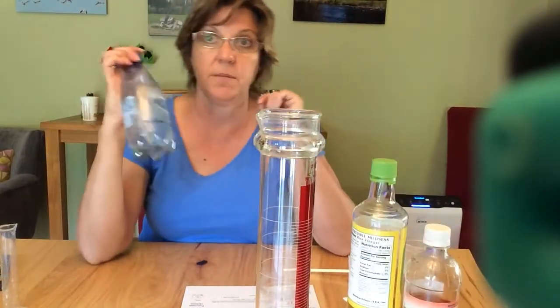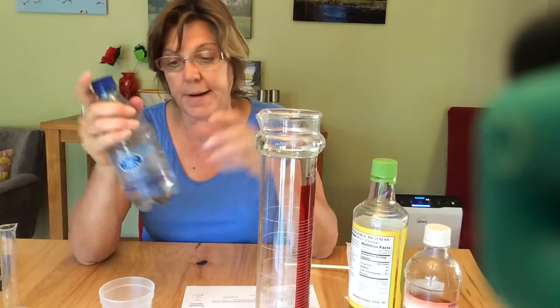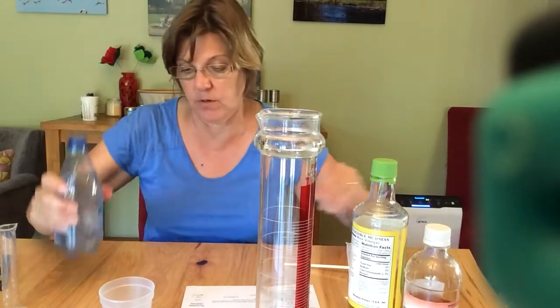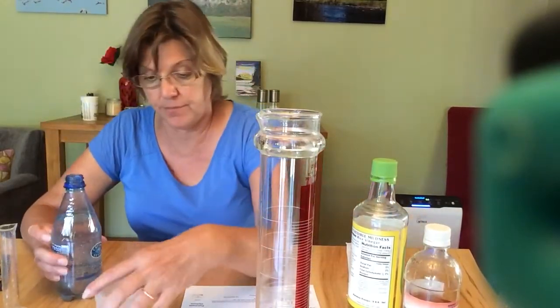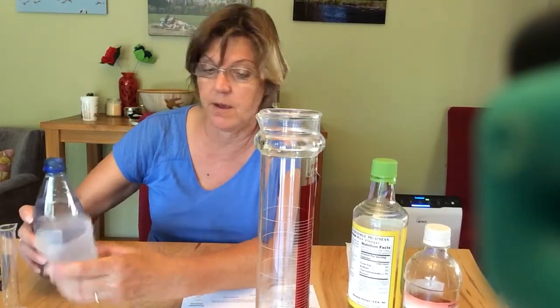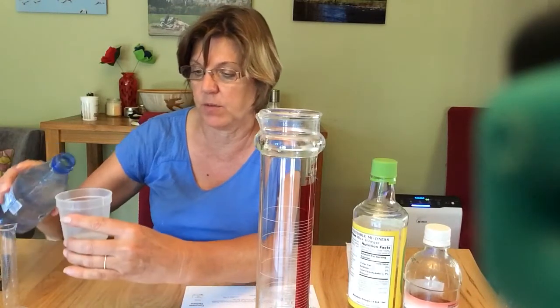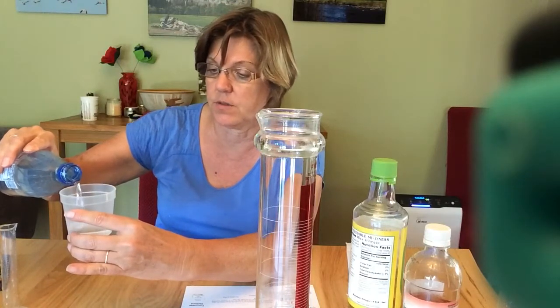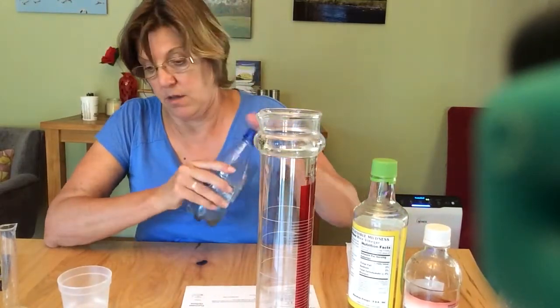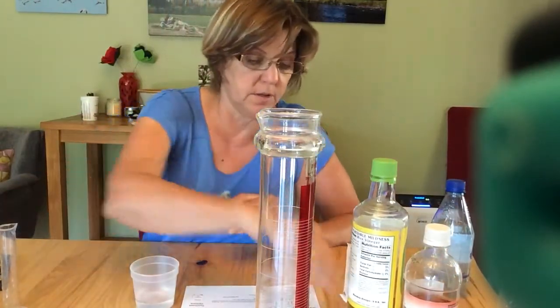The lake water that I'm going to use is from a lake called Quarry Lakes. You're going to use whatever water you have: lake, stream, river, marsh, bay, ocean, or even a fountain or a pond. I'm going to use 50 milliliters for each. Oh, what the heck, I'm going to use 40 milliliters because there's a nice mark on here. I'm going to fill this up to 40. Remember, if you're going to do more than one sample, make sure you use exactly the same amount of lake water.